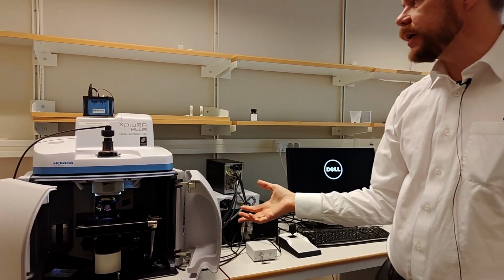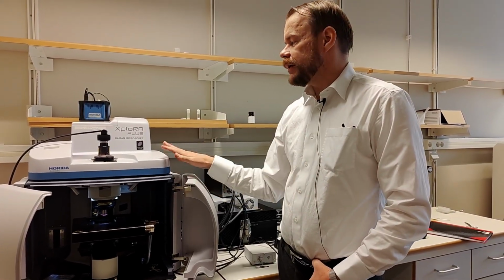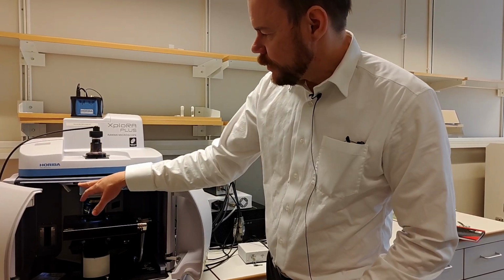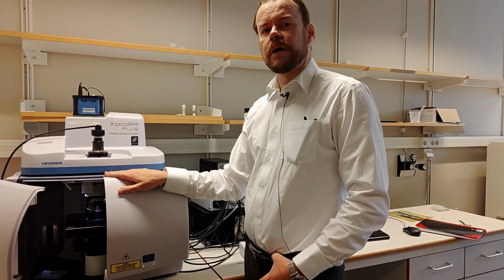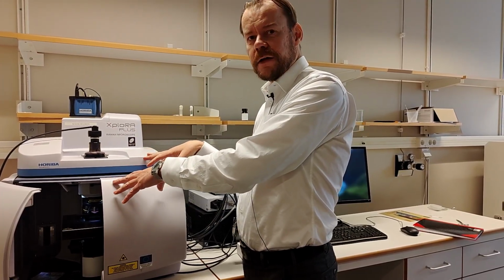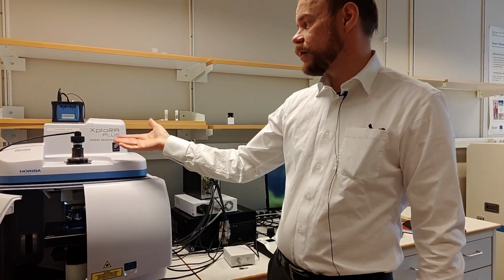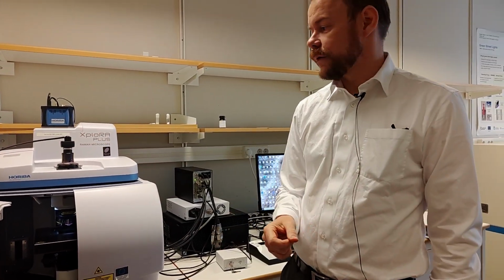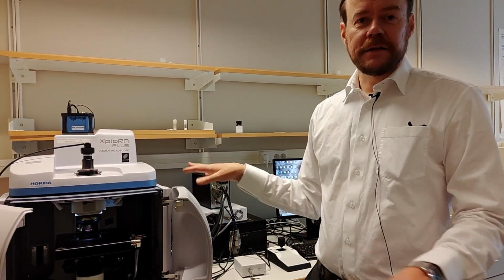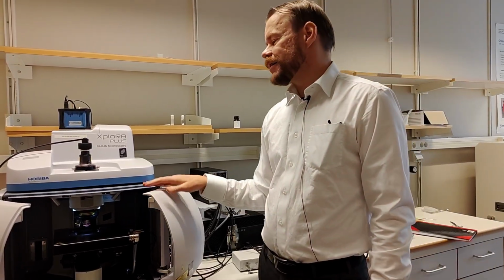Since this is laser equipment, there are laser safety precautions here. But this is a very user-friendly machine because you see there are micro switches here. You need to close the doors, and that will enclose the whole area where the laser is. So there's no risk you expose yourself to the laser beam, even though it's quite a strong 100 milliwatt laser. So you're fully protected. And if you open this, the laser is immediately blocked, cut, so if you open it by accident, you are safe.